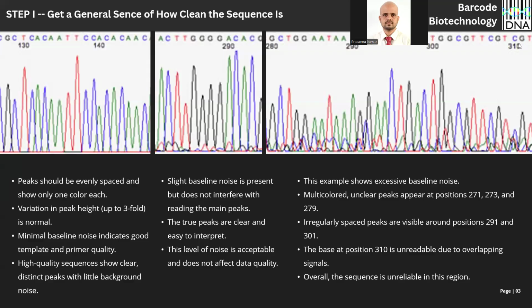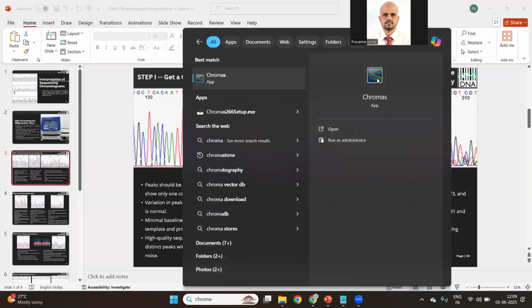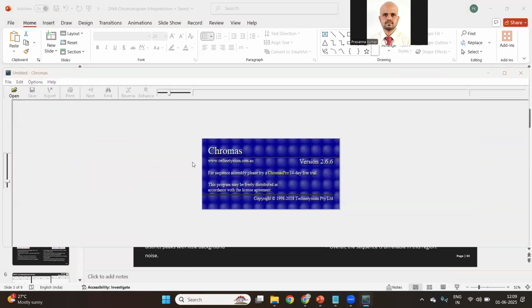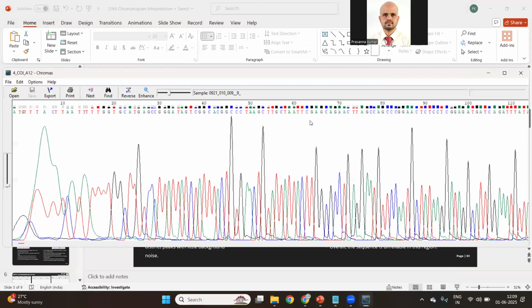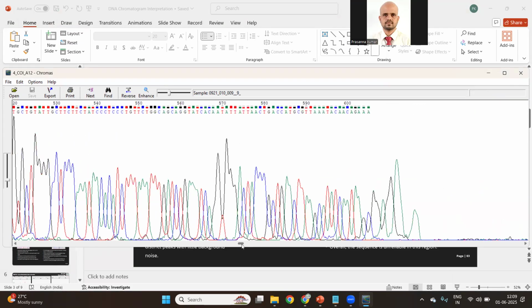So how to call it as an N? Just open the chromatogram. When you are working with a particular file, just open the file. If I want to call this, this is a very clear peak. For example, here, it's very much clear that there is no T here, but these are evenly spaced A. So there is no T here. So just delete it: select the T, press delete.